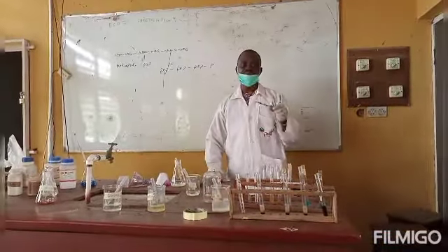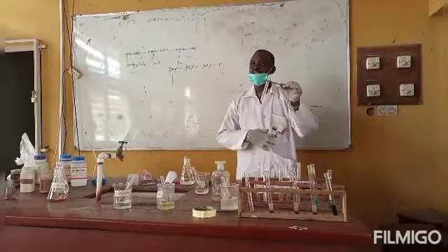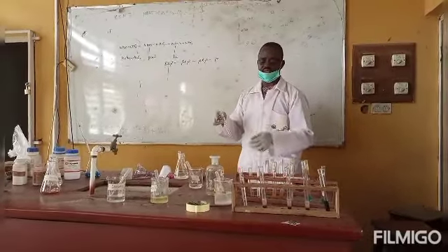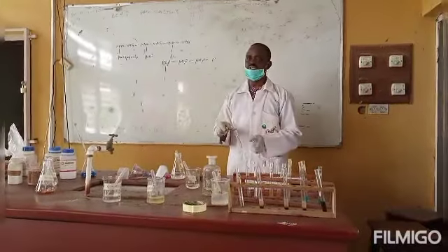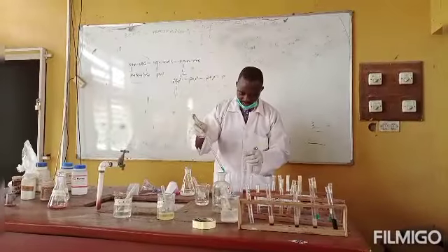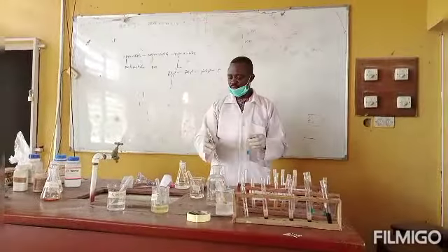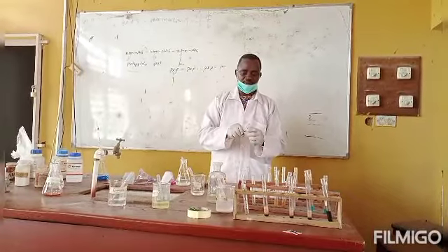The next thing on the preparation inside this test tube is to carry out Benedict's reaction on it, to know whether the mixture will test positive to Benedict's reagent or not. So we will take 1 ml of this solution into another clean test tube, add 1 ml of Benedict's reagent to it, and then boil for 2 to 3 minutes in boiling water. I have my 1 ml of the hydrolysate in the test tube, and I will now add 1 ml of Benedict's reagent to it, and heat for 2 to 3 minutes in our water bath.